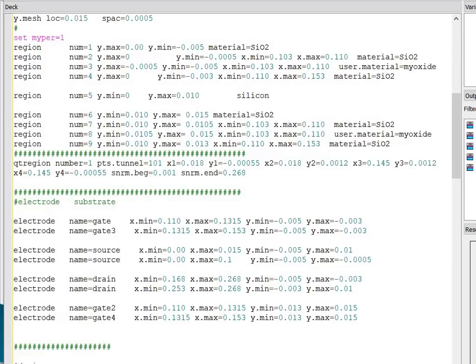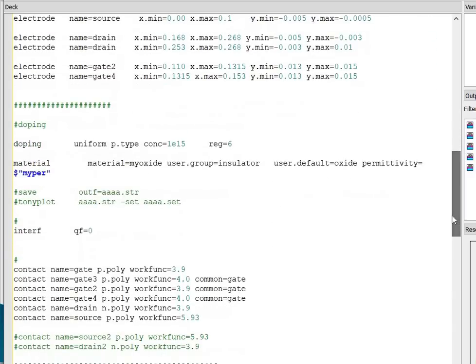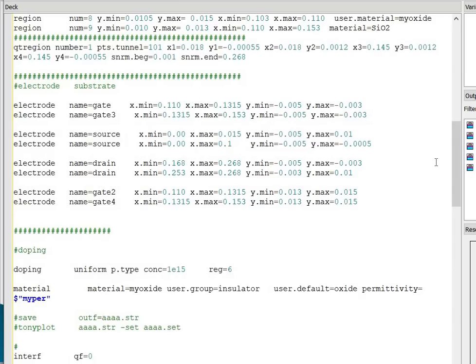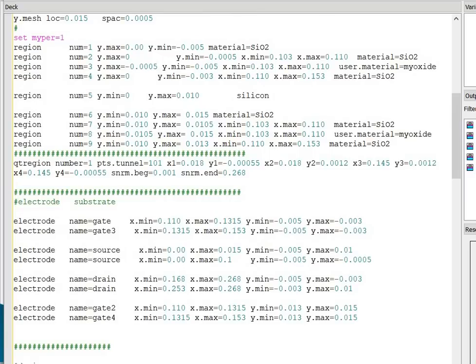You can also define the permittivity in the material section, that is this section. In this section, I have chosen the permittivity and named it my per, fixed at 1. There is one option that you can choose the permittivity 1 at this material section also. After that, I have defined the region statement with different materials.